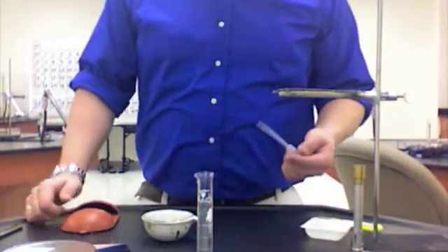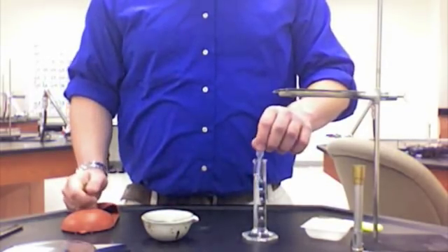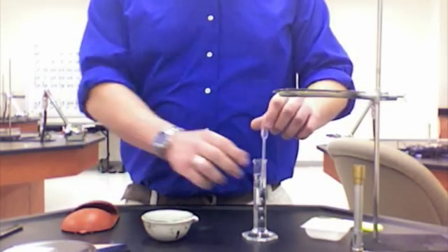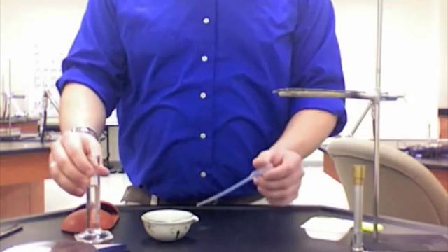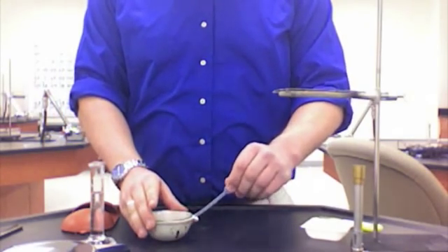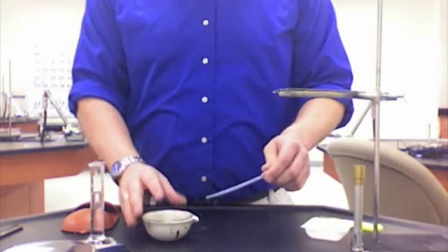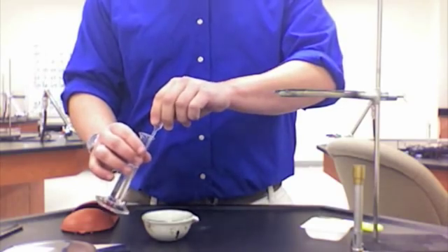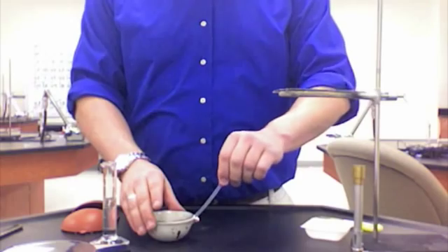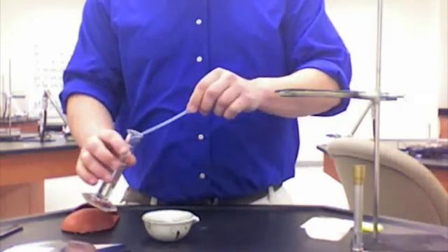The next step, we're going to add the acetic acid to the sodium bicarbonate. When we add it, what we should see is some bubbles. Those bubbles are carbon dioxide, and they indicate that there's a chemical reaction taking place. So we're going to go ahead and slowly add the 25 milliliters of acetic acid to the sodium bicarbonate.